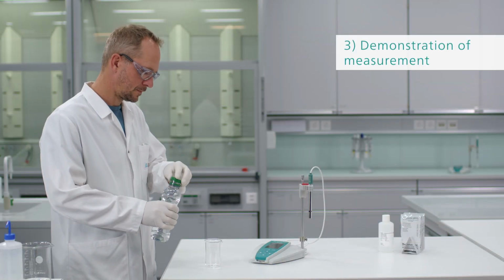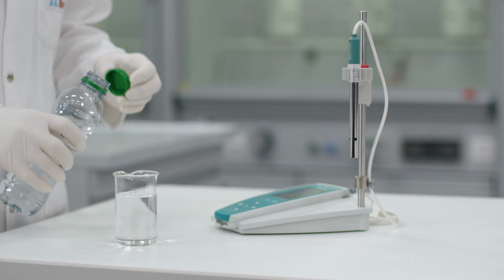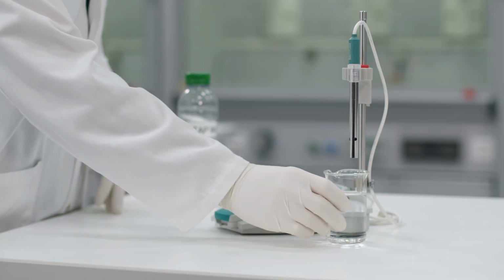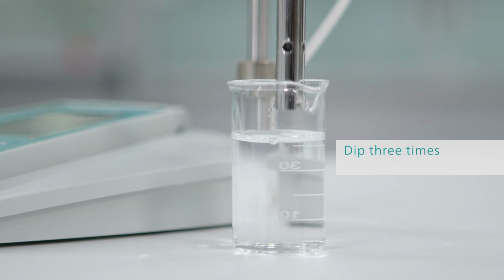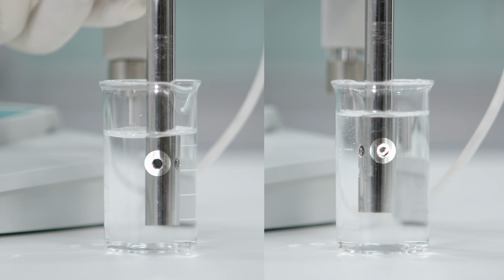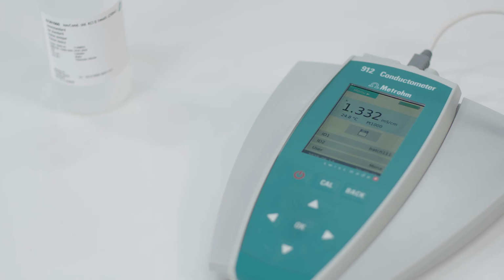Now let's see how a measurement is done. The measurement is very simple. Dip the calibrated sensor into the sample 3 times. This prevents air bubbles from sticking to the cell. The conductometer will show the result once the measured value is stable.